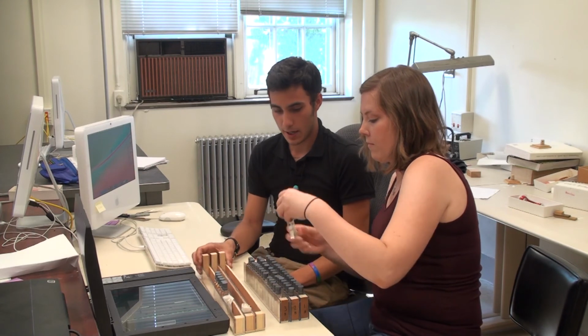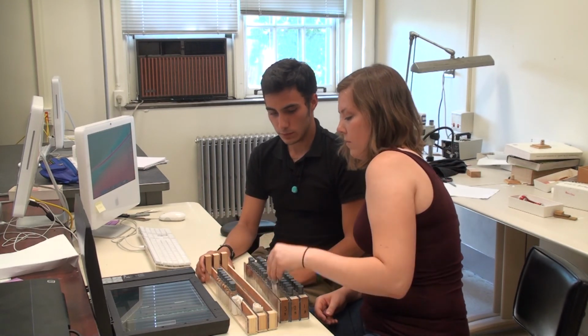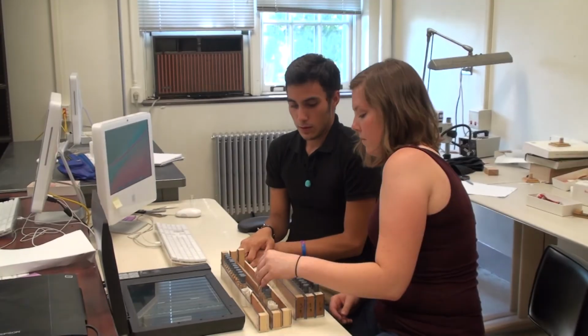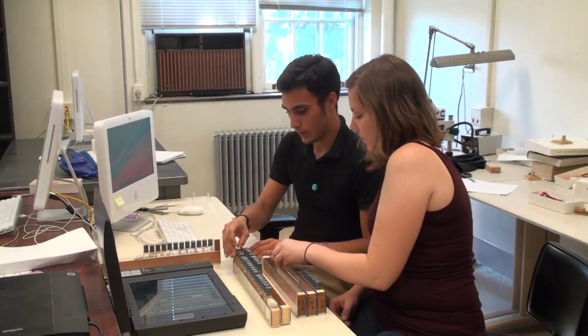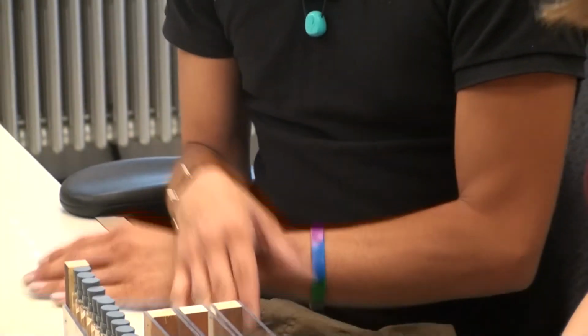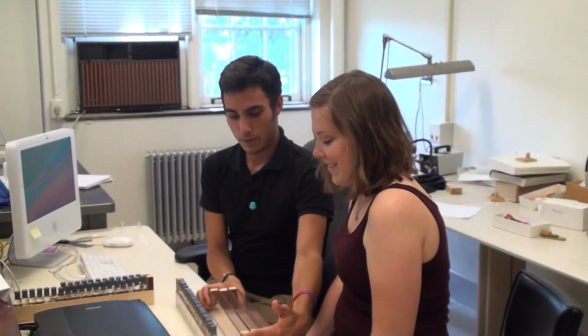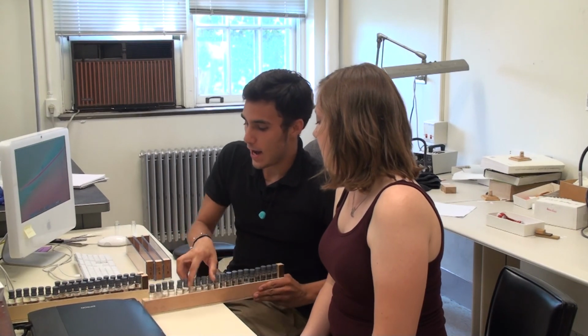And you can go ahead and place them back in, remembering to keep the same order. There we are. That's our first set of vials. Now we can begin to image the next set. So we image them all, and we can upload them now.